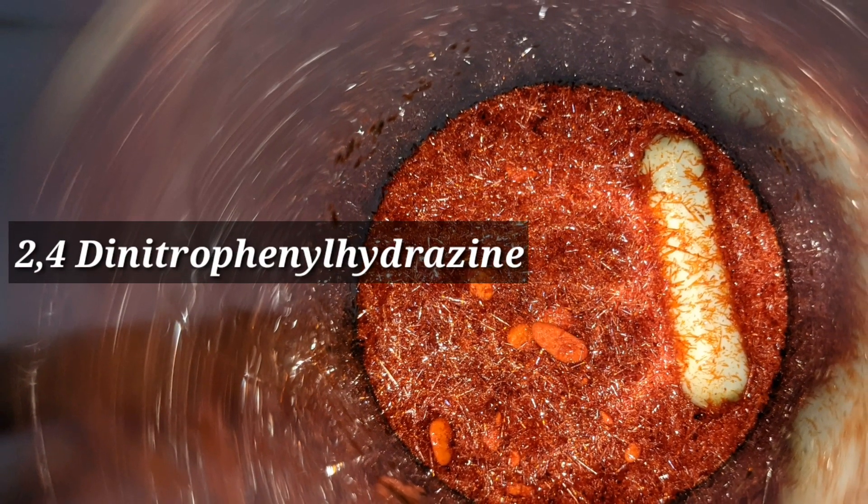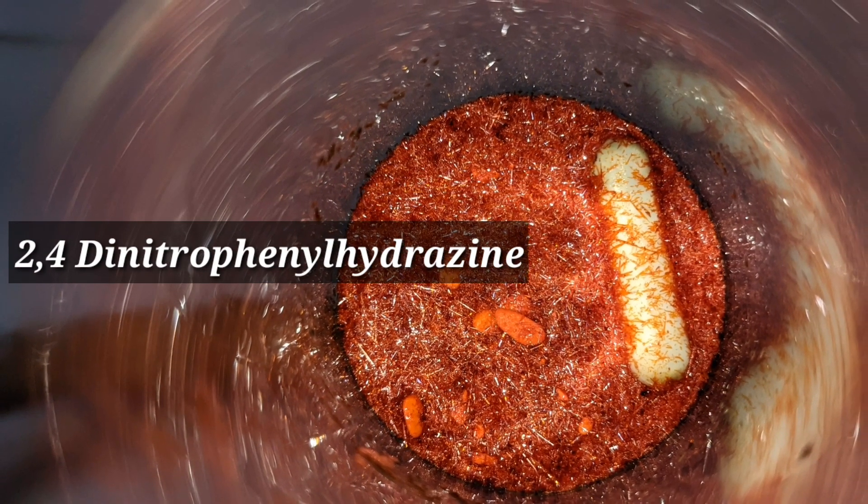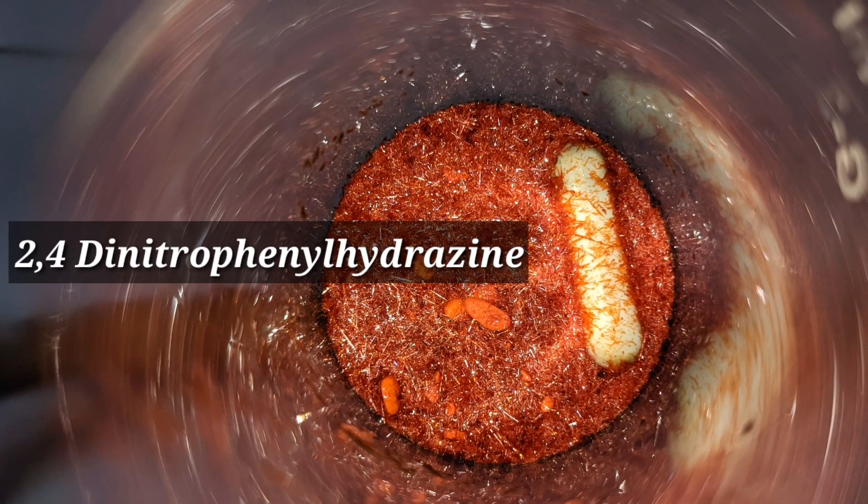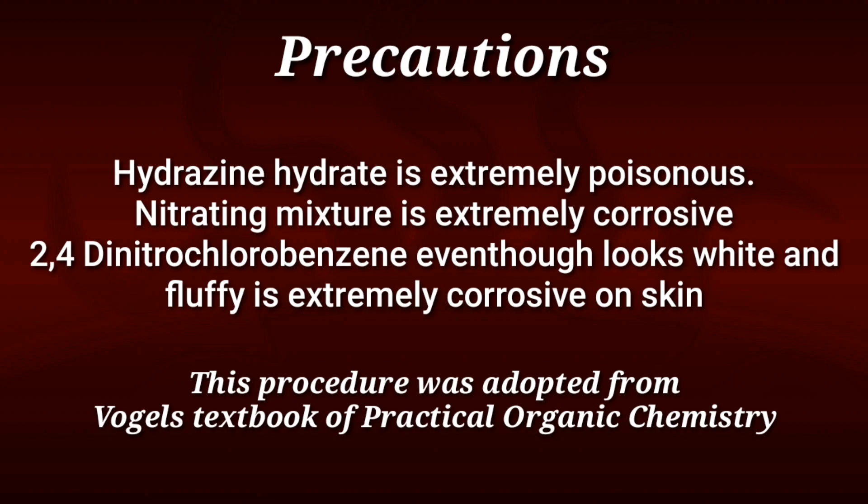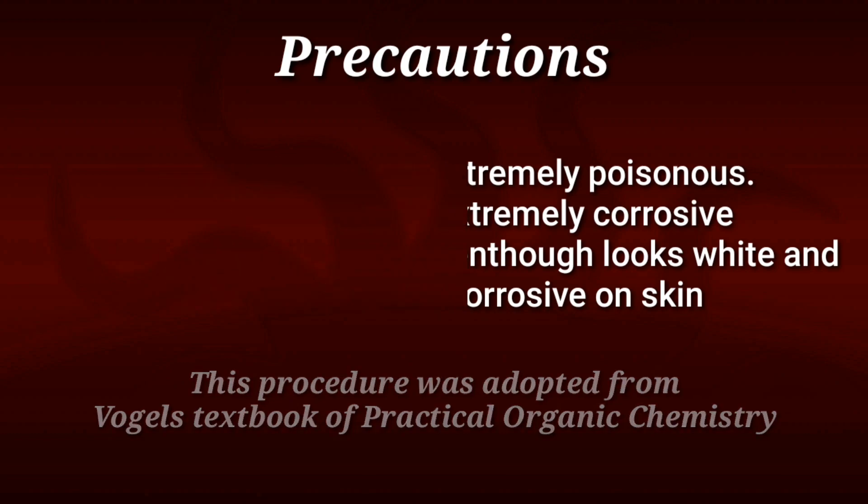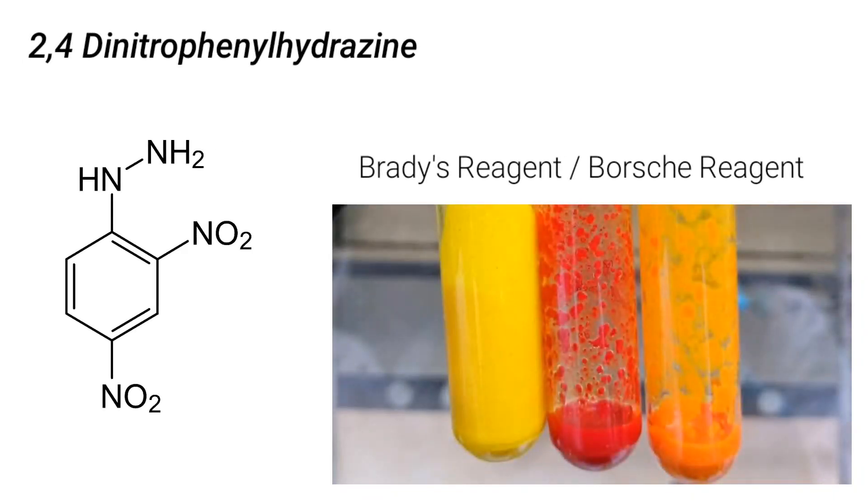Hello friends, in this video we will be synthesizing the compound 2,4-dinitrophenylhydrazine. This compound is of interest in the organic laboratory for the qualitative analysis of aldehydes and ketones.